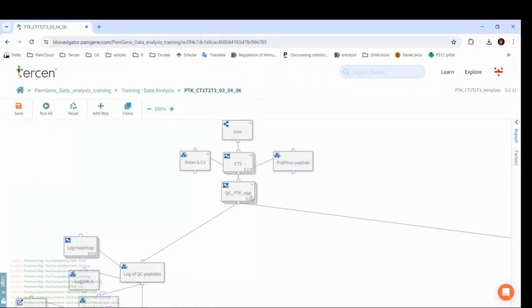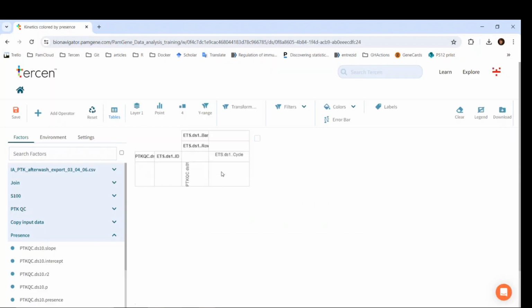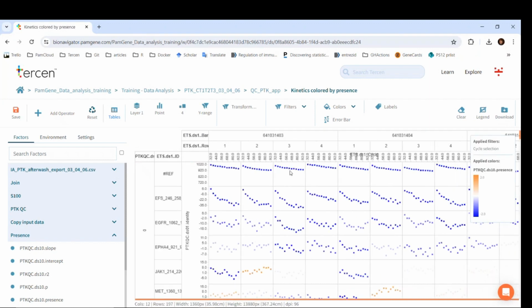When the app has run, we can double-click on it and see that there are two visualizations. Let's click on the kinetics colored by presence. So how does the PTK QC app find which peptides are present or not?